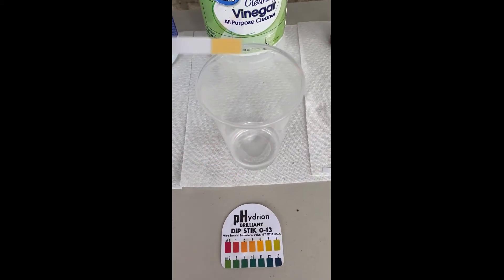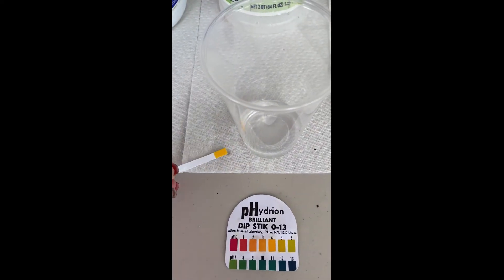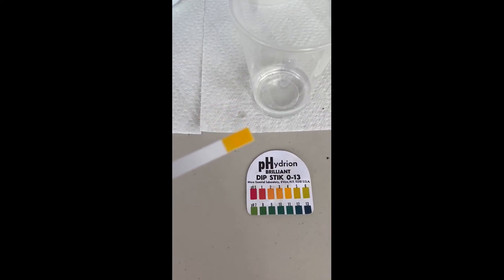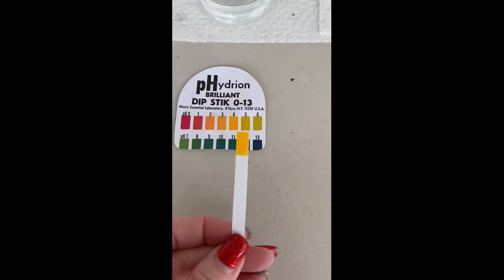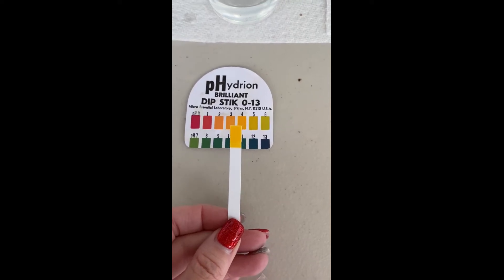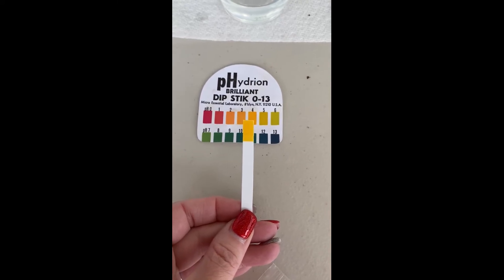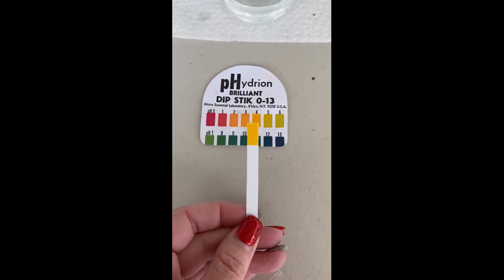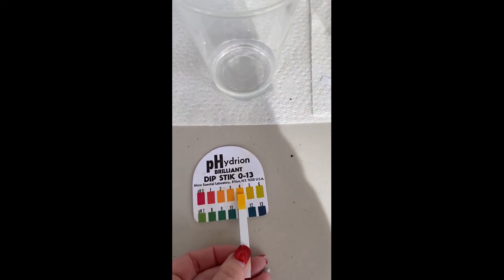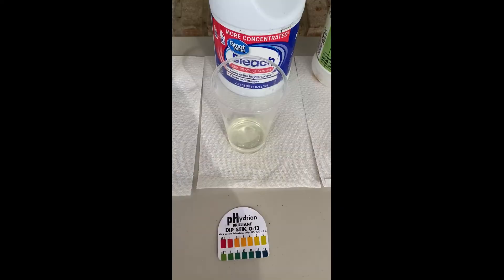Moving on to vinegar — go ahead and dip it in and we can start to see our results. As we start to match this one up, you can see that it's very, very bright in color and it's not matching our swatch very well. So I left it to sit there for a few minutes and came back later to check on it. After it had developed in color, it's more going to be along the lines of a 4, so definitely an acid.